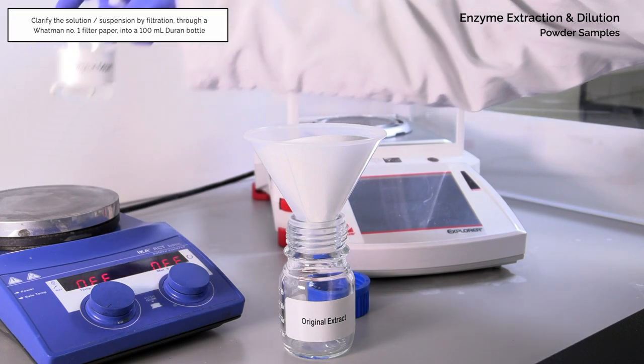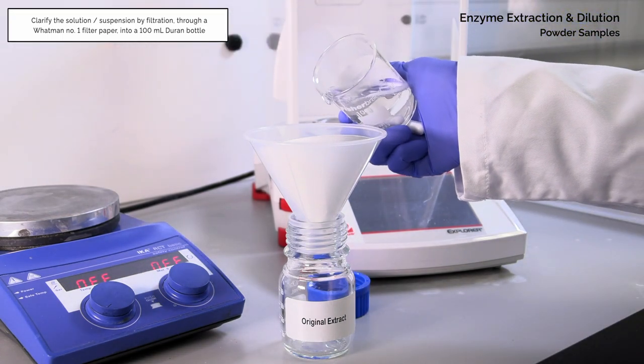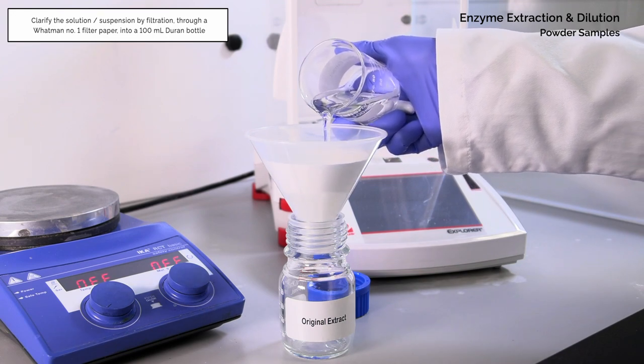Clarify the solution or suspension by filtering through a Whatman No. 1 filter paper into a 100 milliliter duran bottle.